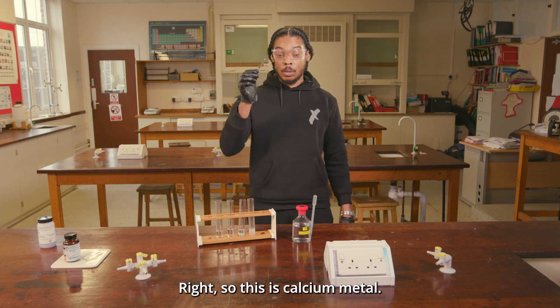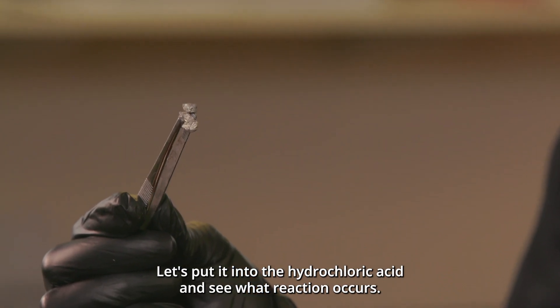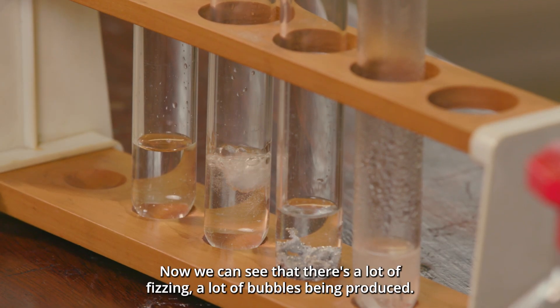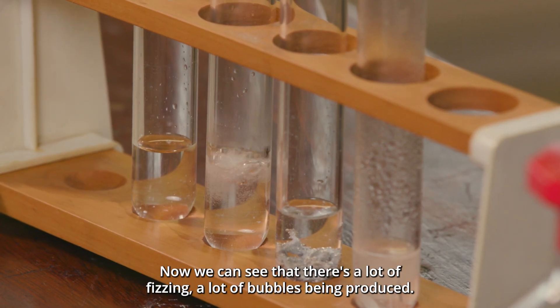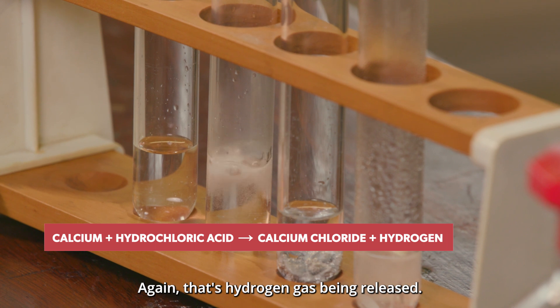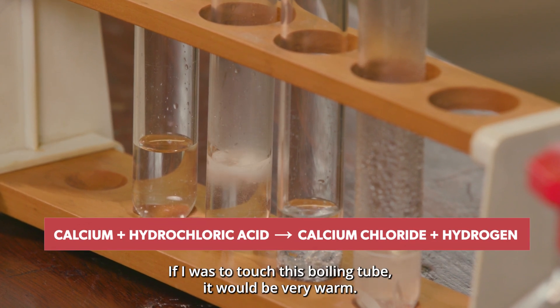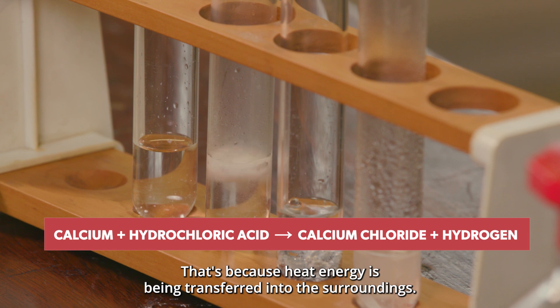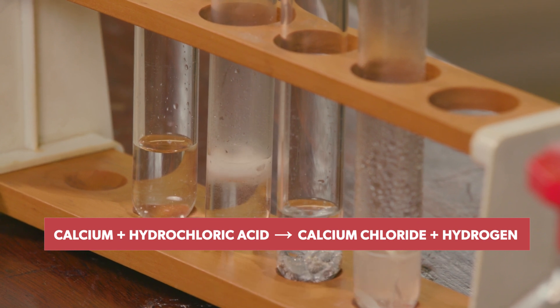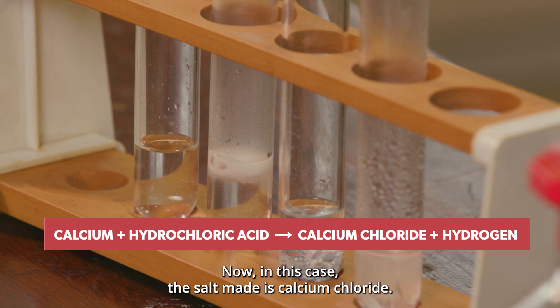This is calcium metal — let's put it into the hydrochloric acid and see what reaction occurs. We can see a lot of fizzing and bubbles being produced; again, that's hydrogen gas being released. If I were to touch this boiling tube, it would be very warm, because heat energy is being transferred into the surroundings. In this case, the salt made is calcium chloride.